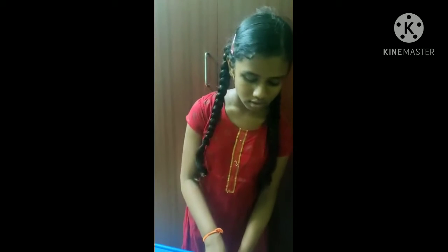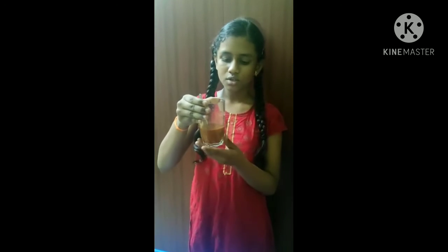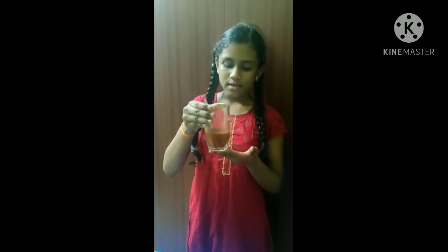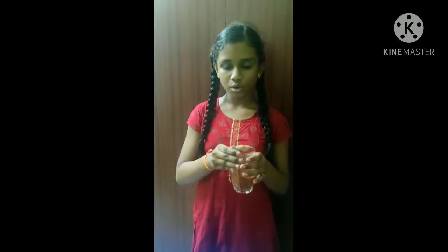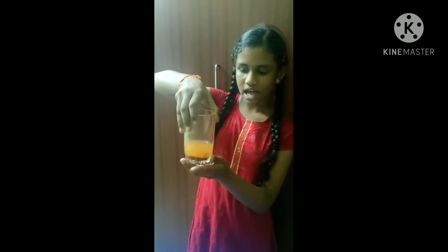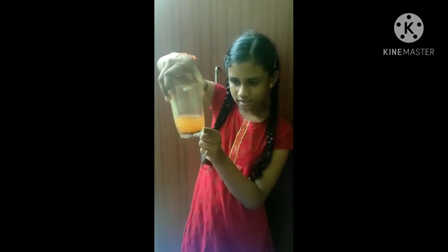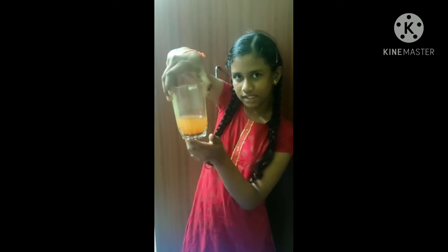Let me explain what sedimentation is. You could be seeing a muddy water sample here. This contains dust particles and sand too. We need to leave this for a while. After leaving it for a while, we get this partially cleared water. The sand settles down — you could be seeing the sand here.